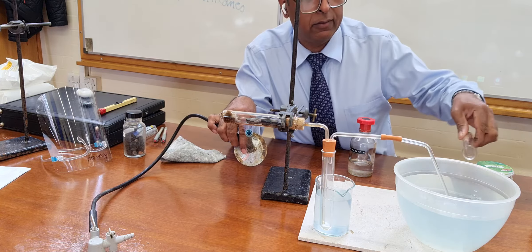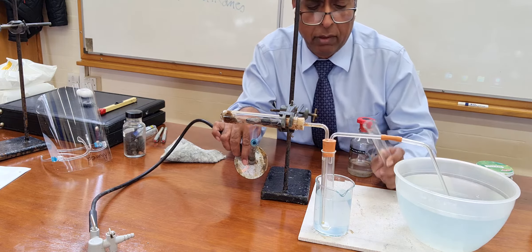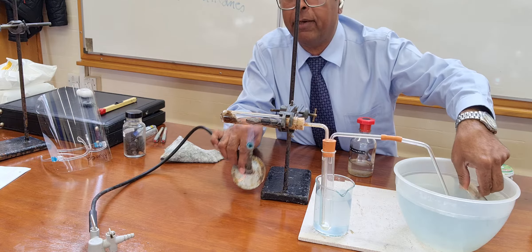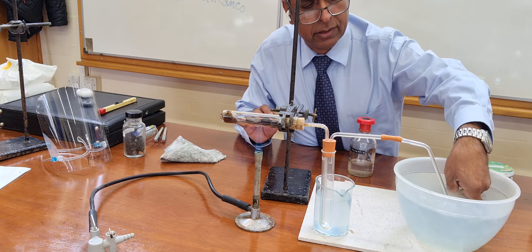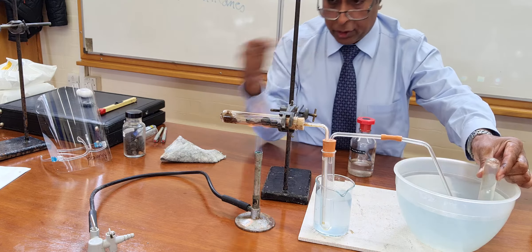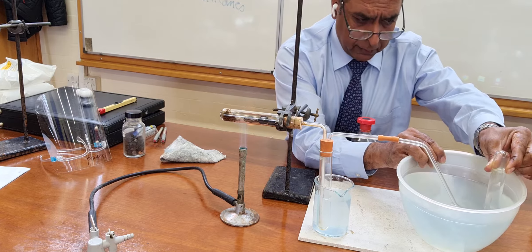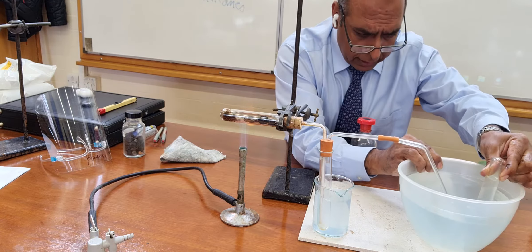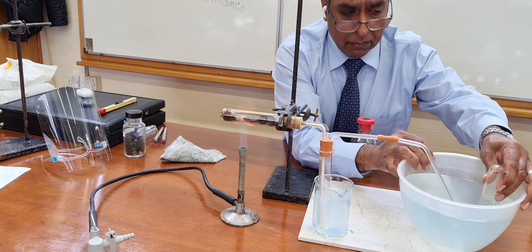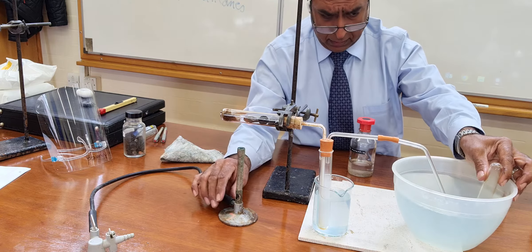I hope you can see here — we've got some bubbles coming out. I'm hoping that we'll get some smaller alkanes here which we'll hopefully see as a liquid. The way to collect bubbles in this apparatus is to fill a tube with water and then allow the bubbles to push the water out. You can see the bubbles coming up into the boiling tube. I've got the mouth of the delivery tube into my boiling tube so that any gas collected pushes out the water.